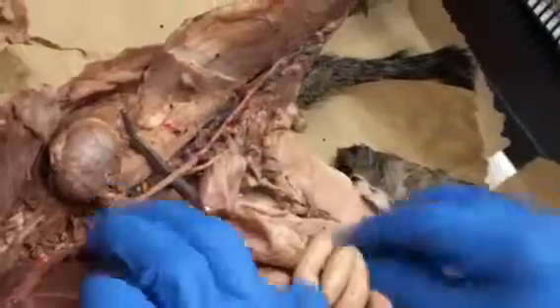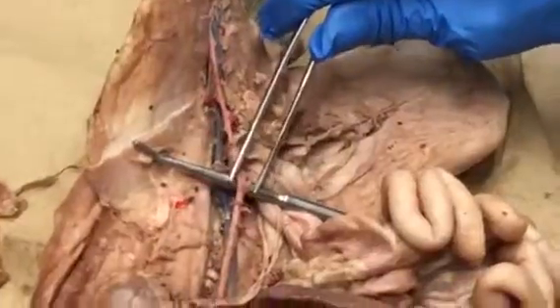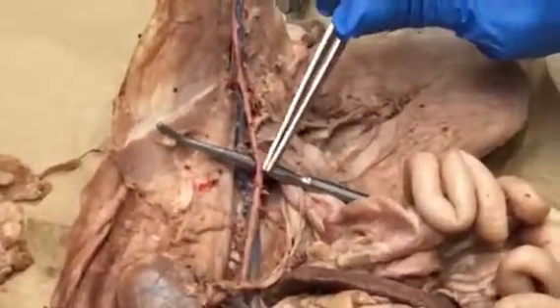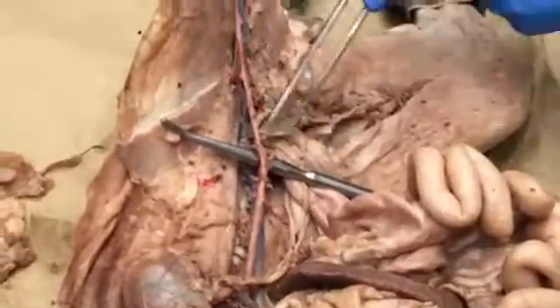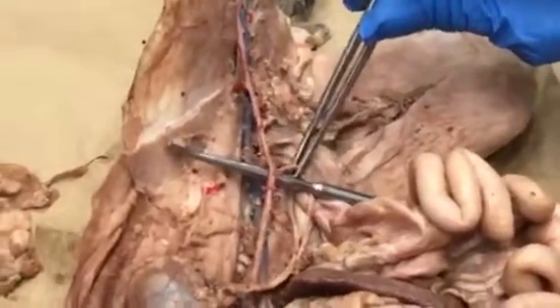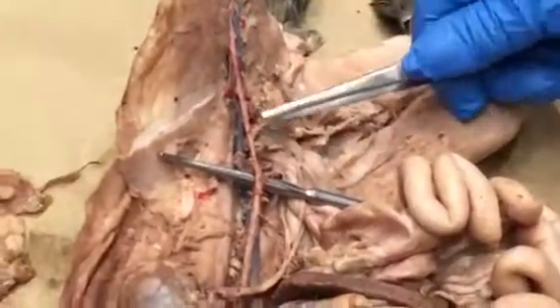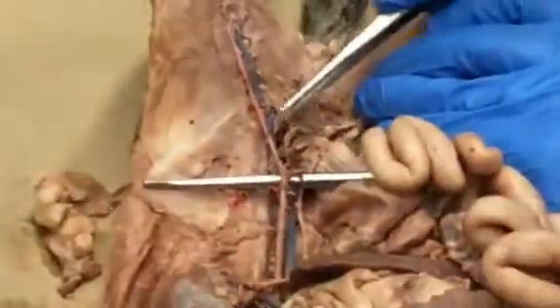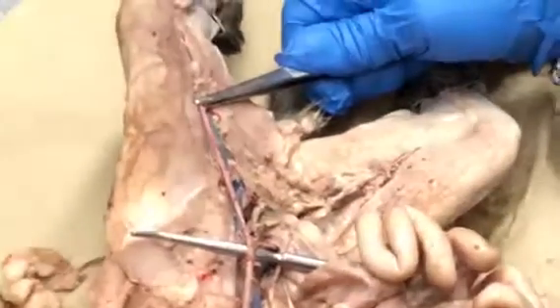Following that abdominal aorta down, we're going to hit this little fork in the road here, where it branches off to the left and the right side. In the center here, it's called the common iliac artery. The common iliac artery is in the center. It'll branch off here as the left external iliac artery, here as the left internal iliac artery. Here is the right external iliac artery. Here is the right internal iliac artery. Those external iliac arteries are going to travel farther down the leg, and down here it'll be called the femoral artery, where it covers the femur.